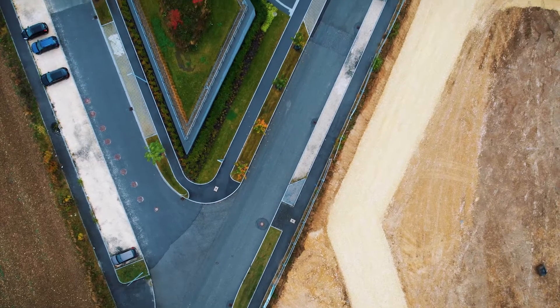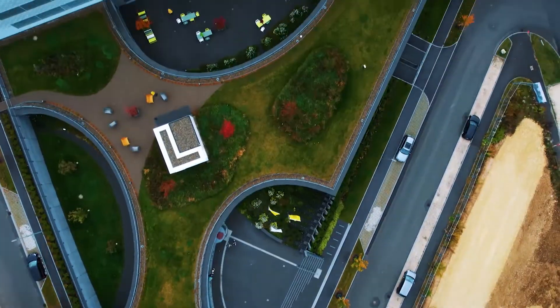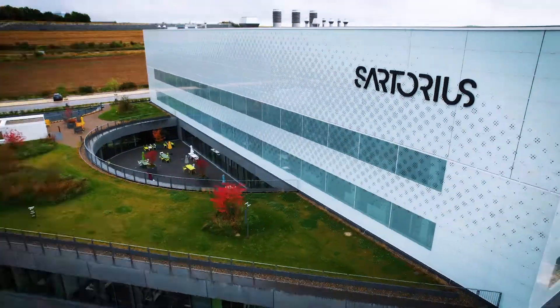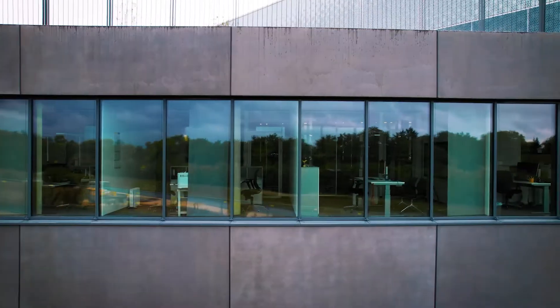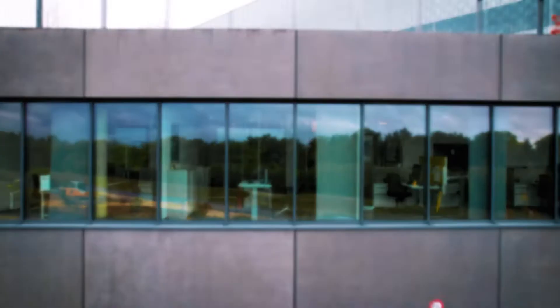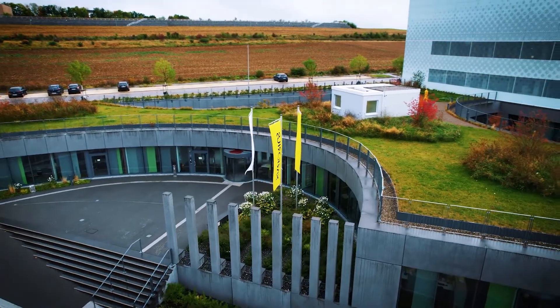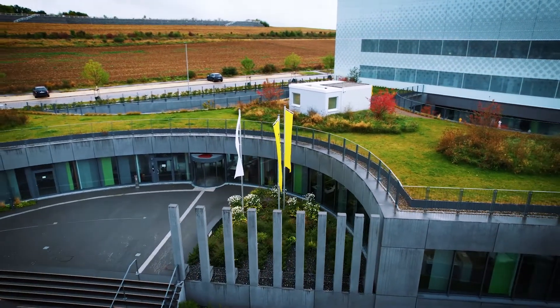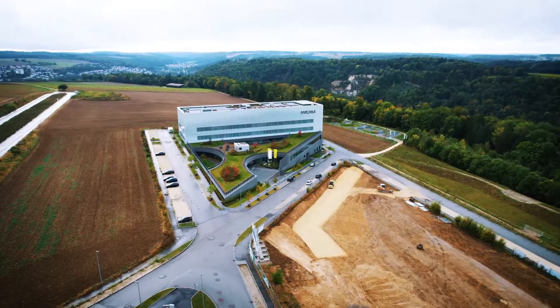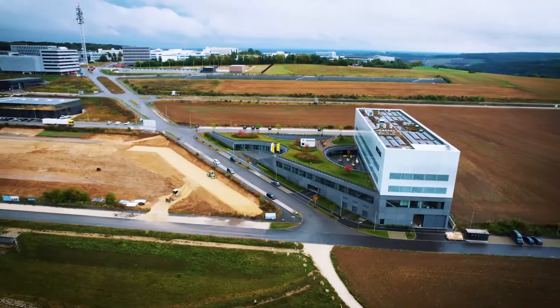To meet our growing customer demands, we invested in a new 6,000 square meter facility in Ulm, Germany. We moved in at the beginning of 2020, and today there are approximately 120 staff members working across a number of departments, including product development, client management, and laboratory management.